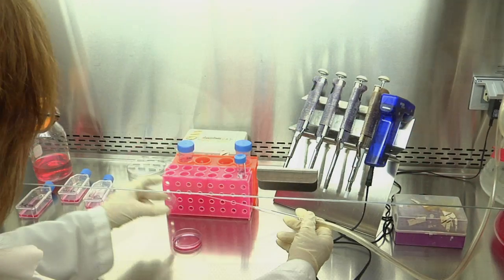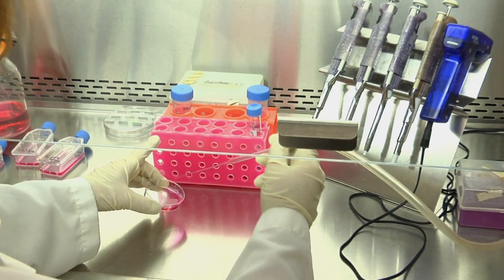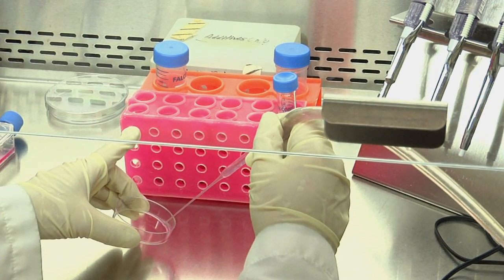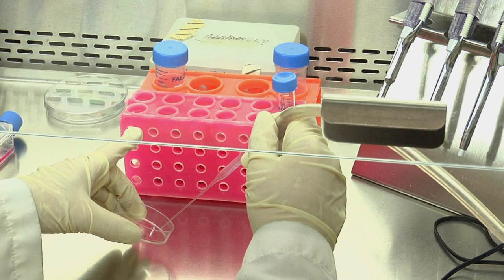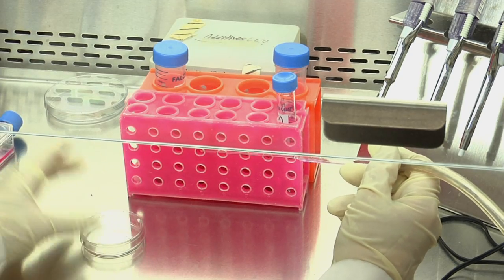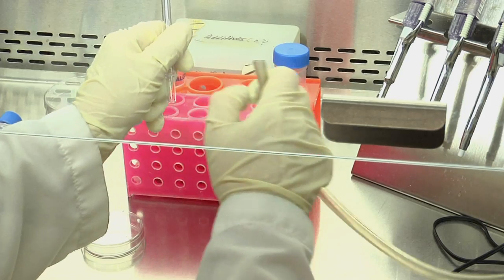Place the pipette on the aspirating tube, remove the lid of the plate, placing it down on its external surface, and aspirate the medium from the side of the slightly tilted dish in order to avoid touching the cells attached to the surface of the dish. Place the lid back on immediately before removing the pipette and disposing of it in the proper container for sharps.